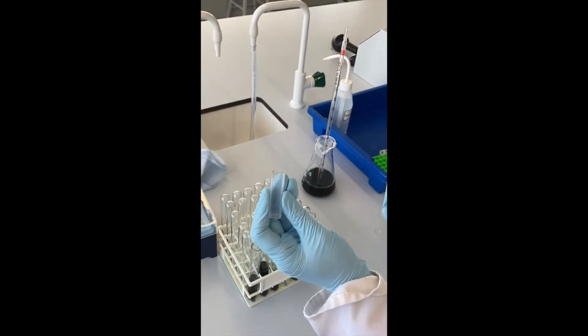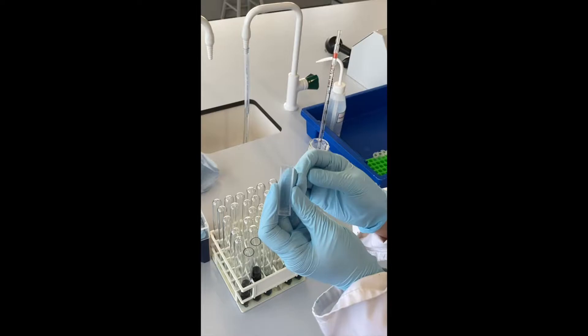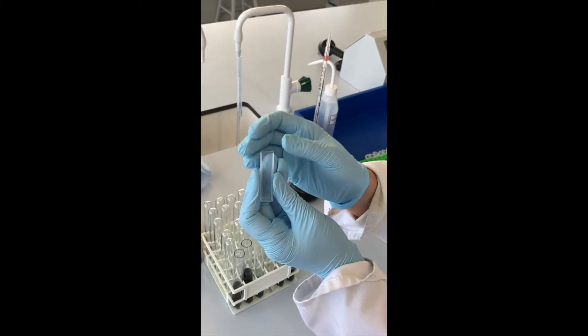When you're ready to take your readings of your samples using the spectrophotometer, you need to decant your solution into the cuvettes.